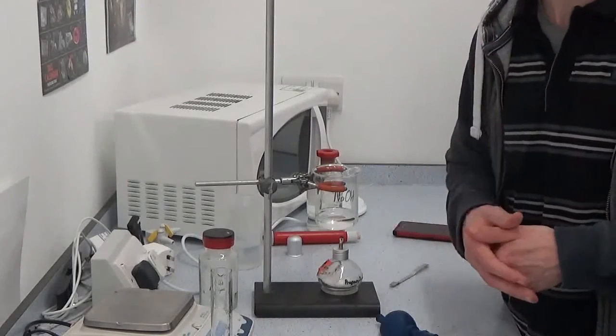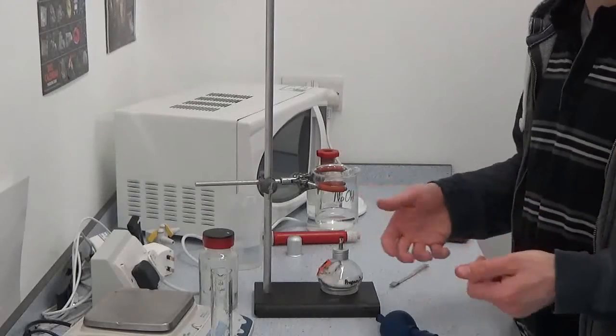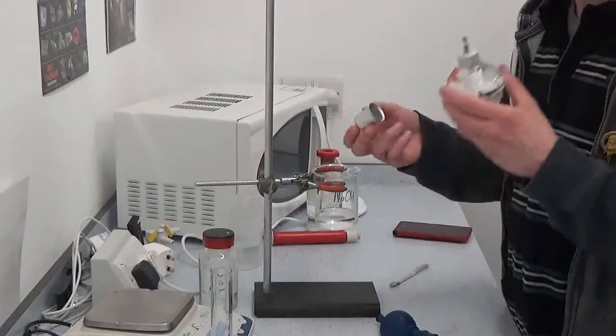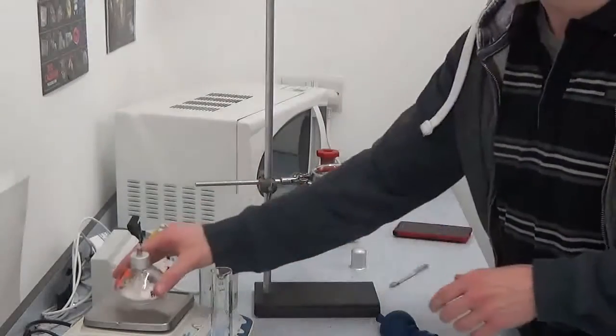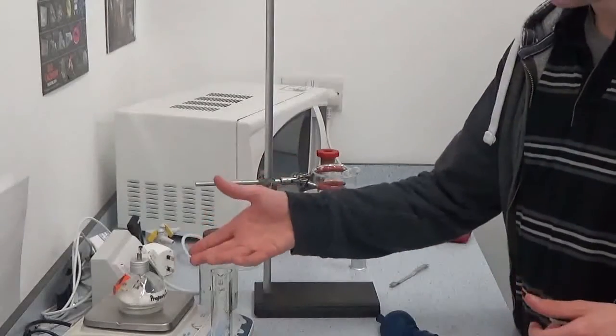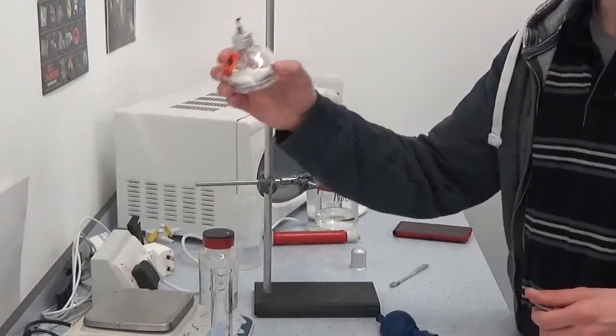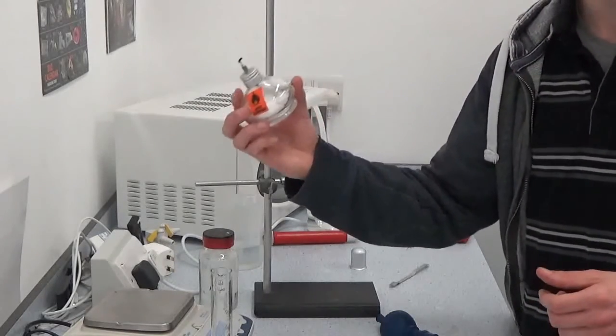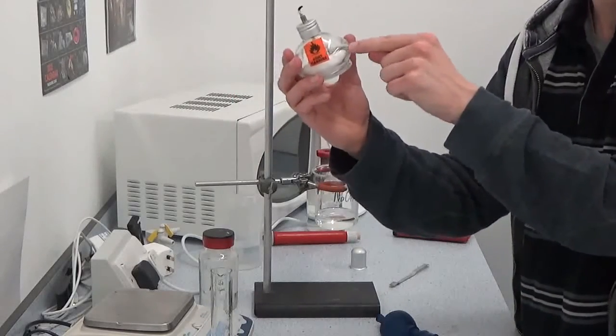So let the water heat up by 20, 30 degrees Celsius. Stop the fire, easiest way to do it, if you can't blow it out just put the cap on. And then record the mass. So obviously the change in mass between what you started at, what you finished at, you need that for working out the number of moles that was burnt. So when you work out delta H with Q over N, that's why you need the mass of this.